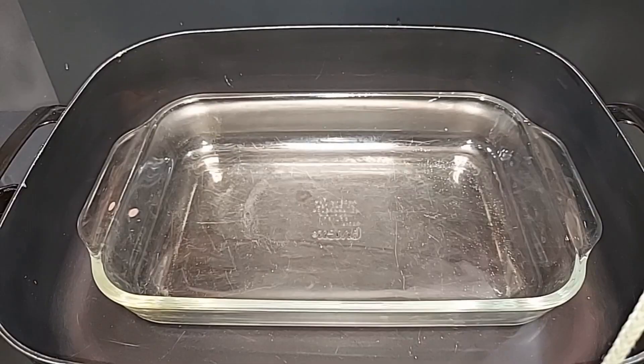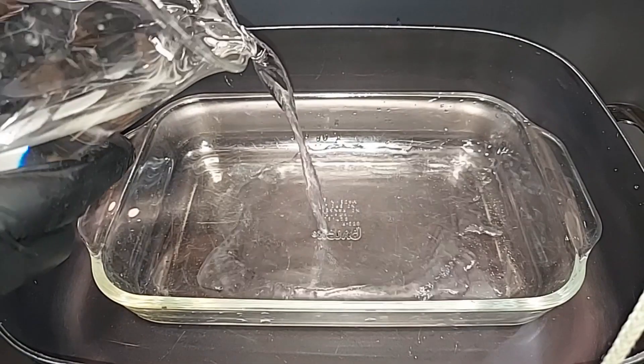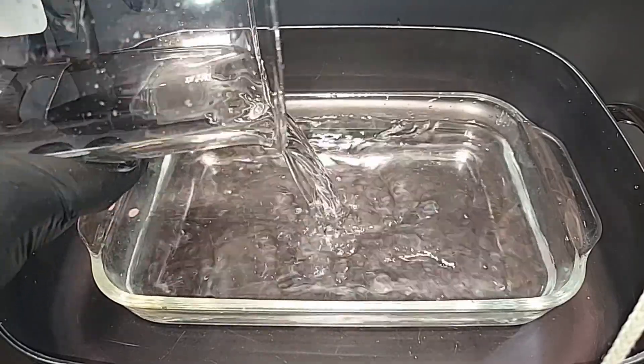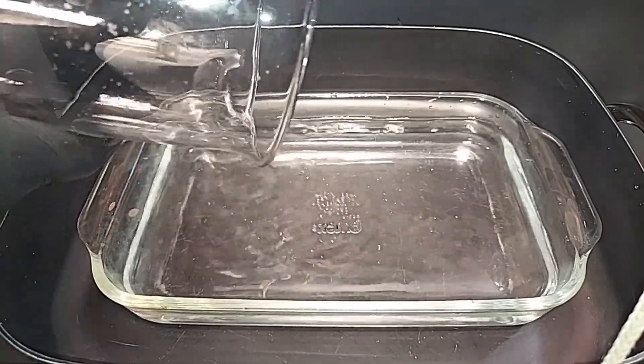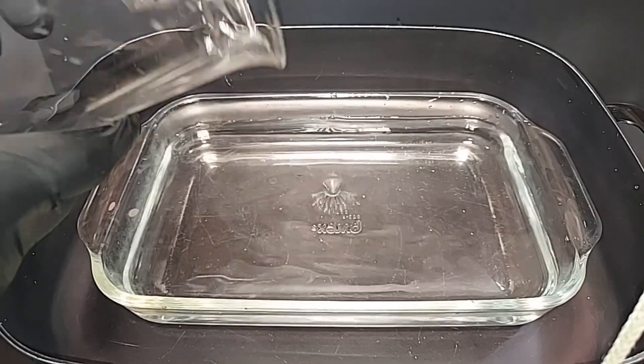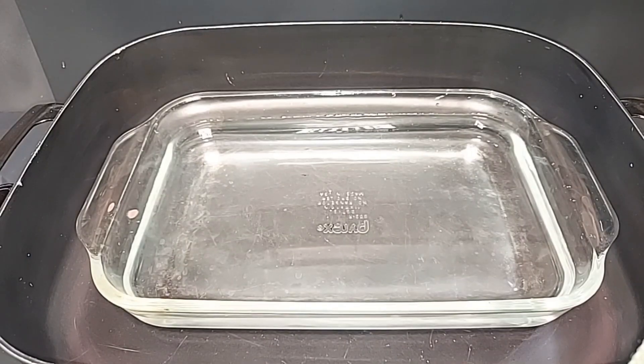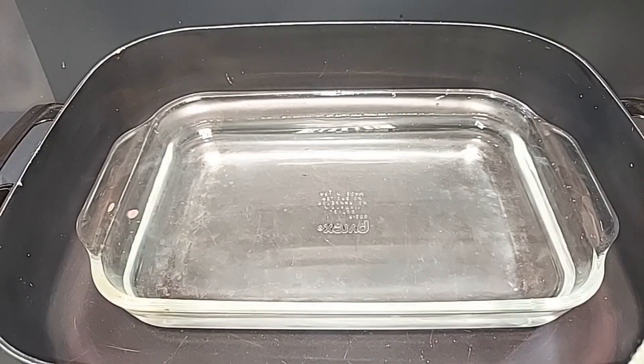I'm pouring the one liter of ammonium sulfate solution that we have here into a two liter Pyrex dish. Turning the heat on high, monitoring the temperature closely. We'll do this until either we start seeing crystals form or the solution is getting so low that we'll just test out fridge or freezer to see if we can get crystals to form.